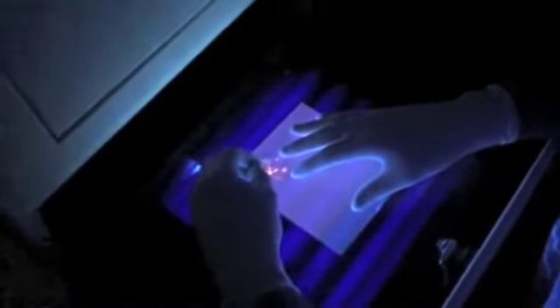Then I am picking it out with a corner. Can you see that? That's the thing we want, and it is AGO in lane number four. Shove this right into the tube. It's still glowing. Cool, huh? Let's do the next one.